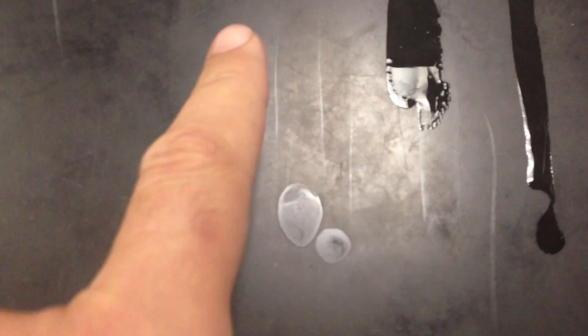Look at ethanoic acid one more time. Watch how it beads up. Looks like it's evaporating, but it's actually beading up. It looks like it's leaving, but it's actually beading up on itself, just like water. Water, not as much. Looks like it might be evaporating, but it's actually beading up on itself because it's attracting itself.